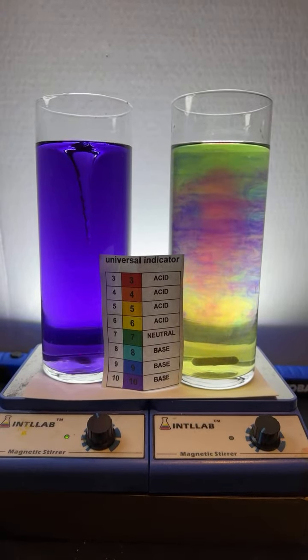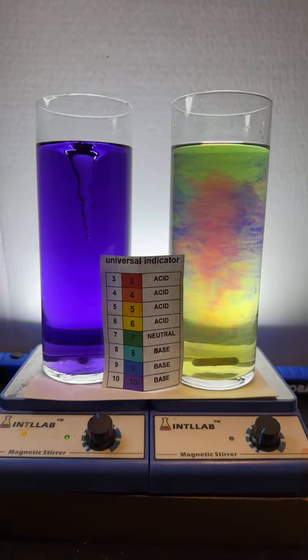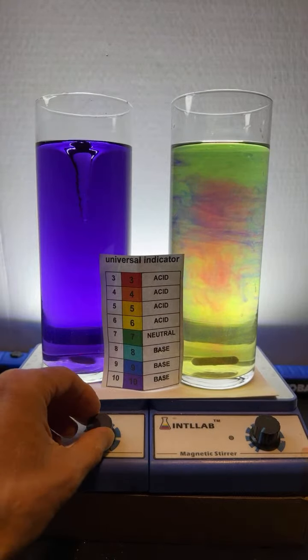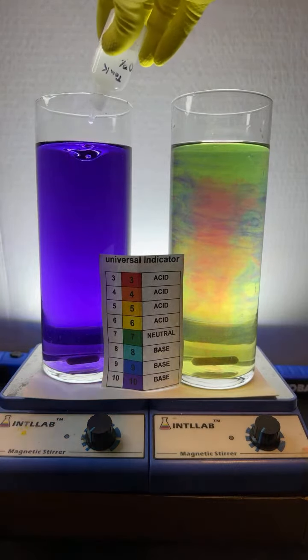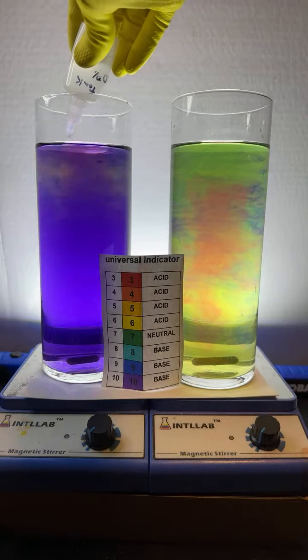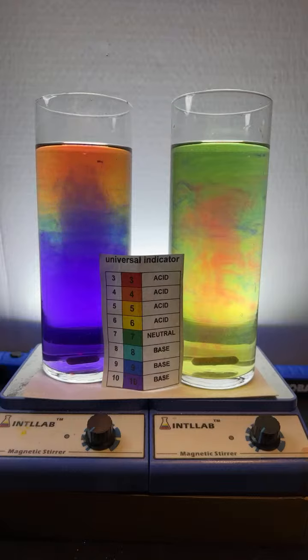It's kind of cool, huh? Kind of beautiful. All right, I'm going to turn this one off over here on the left. I'm going to add a bunch of acid over here on the left. See what kind of pH we can develop over there. Look at that. You got like the whole rainbow growing in there. Isn't that cool? It's beautiful. Very pretty. Look at that. We got that rainbow action going over there on the left.